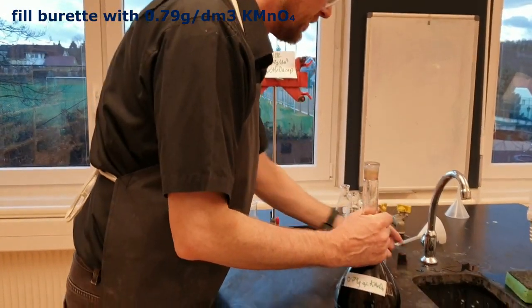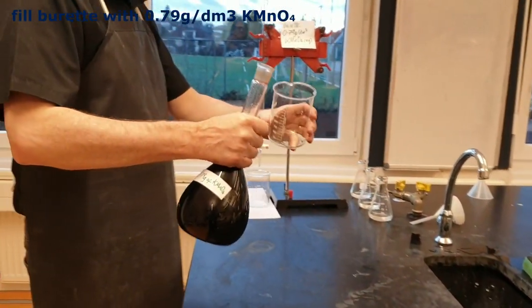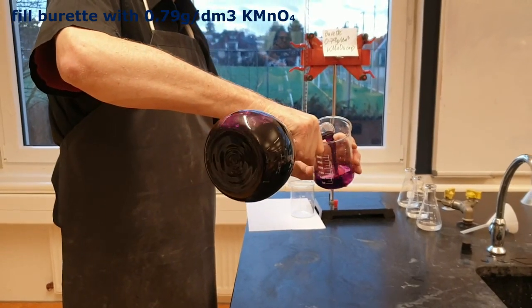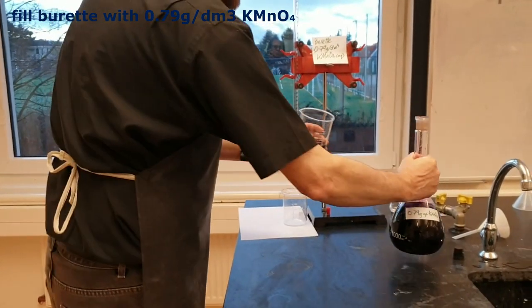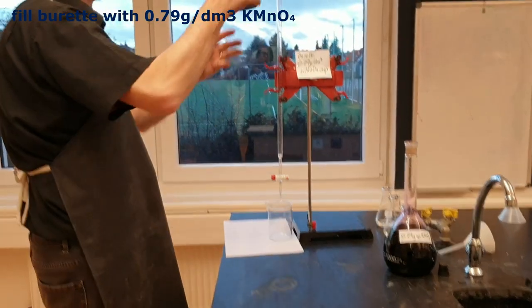We're filling it up with ethanol and she saturated herself with ethanol. Oh my God. What a way to lose my job. If she would have set herself on fire. Okay, so I'm going to pour it into a clean beaker. And then I'm going to transfer it into the burette.